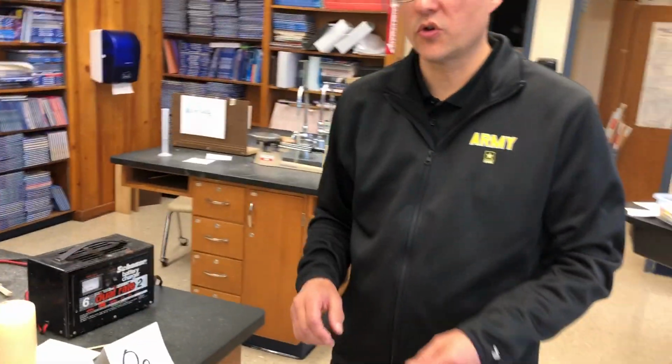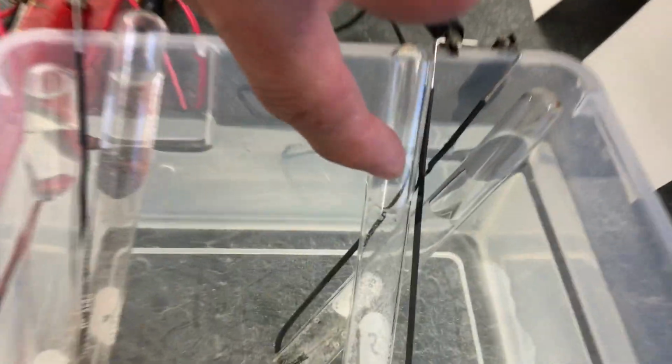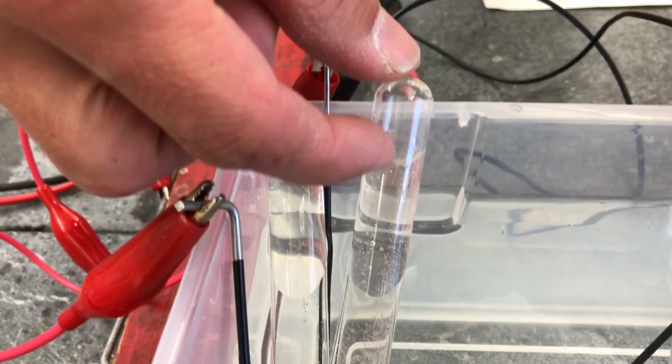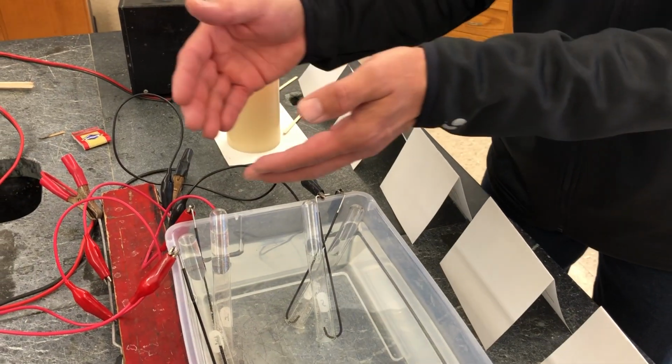And I'm also going to try to demonstrate to you that, in fact, we did produce hydrogen gas. So I'm about ready to turn off the electricity, so I have no more electricity going through here. And one thing I want to point out, if we just look at this test tube right here, the column of gas in this test tube is about this far, whereas in this one over here, it's about half as much. So that means, remember I said that the black is the negative electrode and hydrogen is a positive gas, law of electric charges, positive goes to negative. Therefore, we produced twice as much hydrogen as oxygen. Think about the formula for water, H2O, we have produced twice as much.